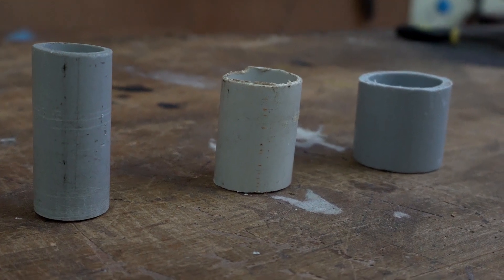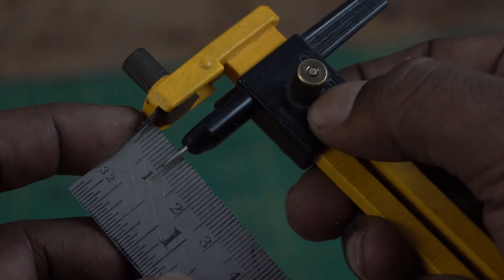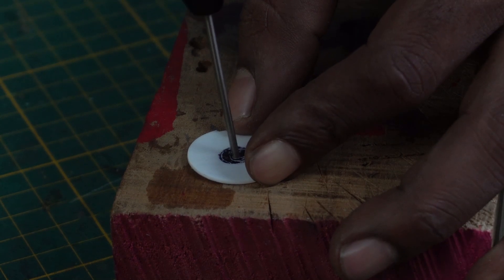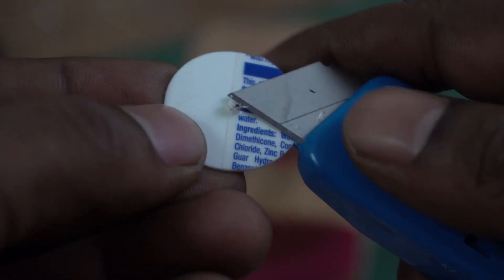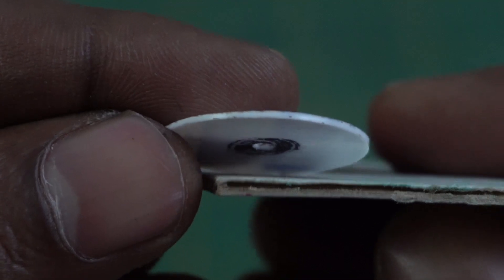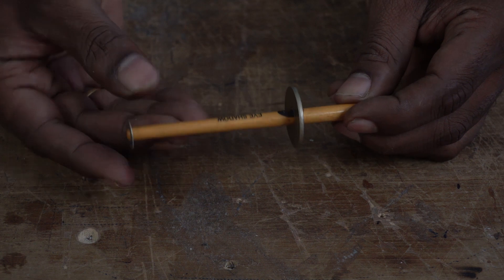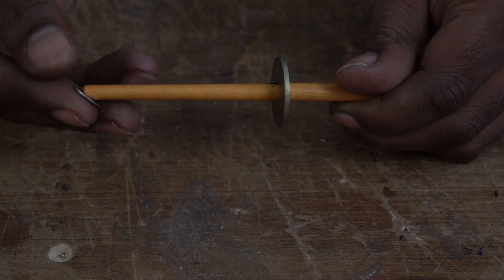With these materials already set up, it's time to make the microscope itself. I am going to measure the diameter of the PVC pipe and divide the measurement by half — this would give us the radius — and using a circle cutter, I can cut small circles on a plastic sheet. I am not tracing the shape because once we place the lens, they all have to be concentric. A suitable size hole is made with a drill bit once the piece is cut. Now drilling leaves a lot of burrs, so this needs to be removed and the workpiece cleaned as much as possible. Note the thickness of the plastic sheet is much lesser compared to the cardboard I used in my earlier attempt. Imagine the orange part to be the light source — light travels in straight lines, and in our case all of it comes from a microscopic point through a lens of 1 mm in diameter. Being precise is super important and I am counting on it.